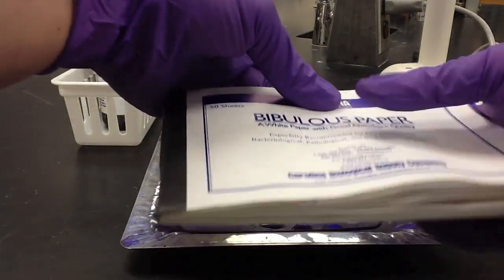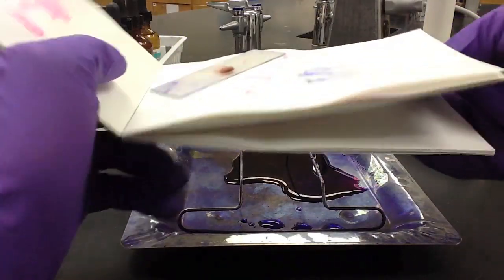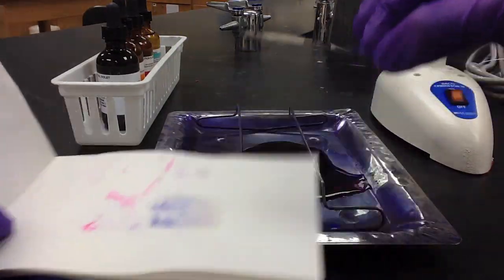Once the slide is fully dry, we're then ready to view the sample under the microscope using oil immersion. Thank you.